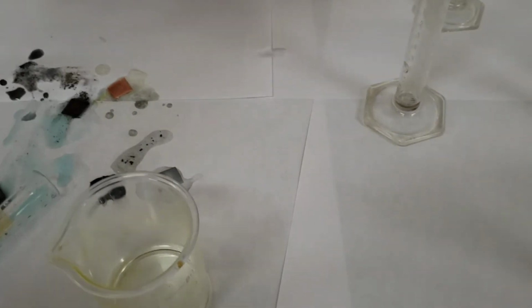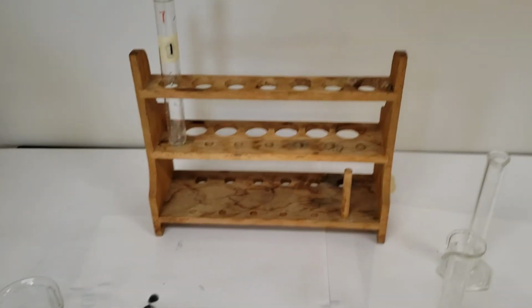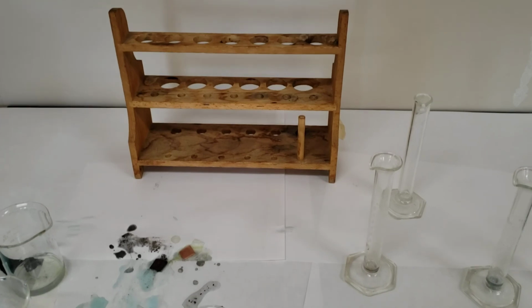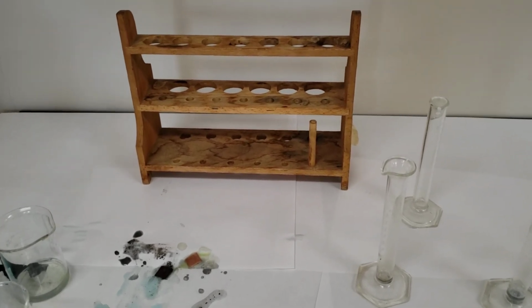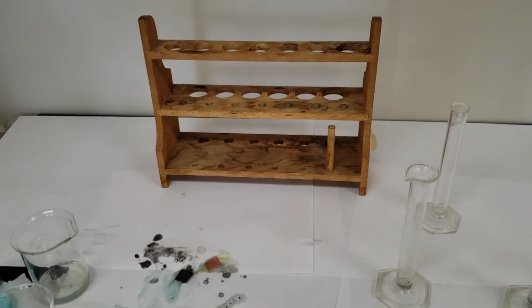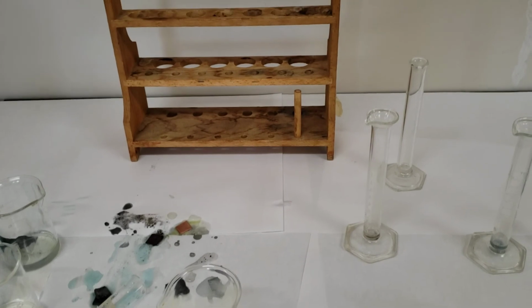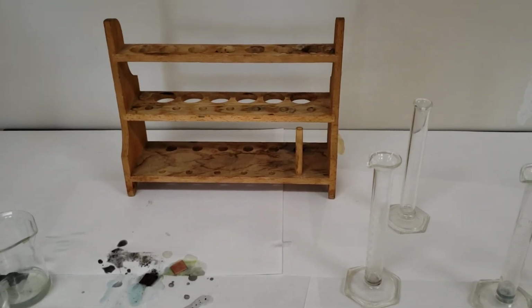All right, so that should give you a better idea in terms of what each one is. So first of all, whether a reaction happened or not, and then what's the indicator? We discussed some indicators in class, how you know if a chemical reaction happened. So tell me if it happened or not with the indicators. And then follow that with, if it was no reaction, just put no reaction. But if there was a reaction, write down whether it was fast or slow in your opinion. All right, so you should be able to do the rest of the lab, and we'll see you again.